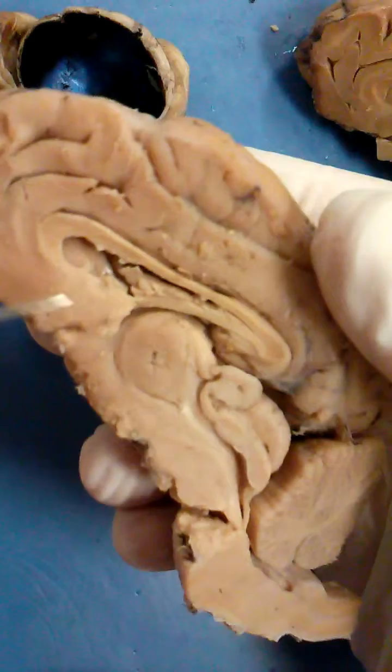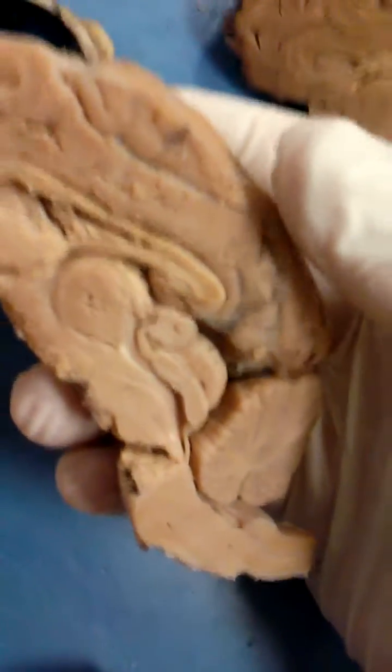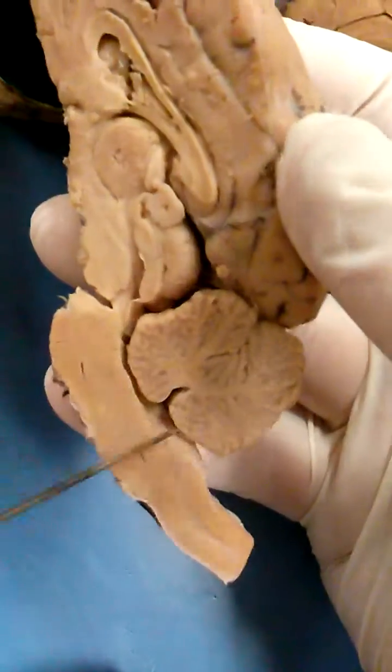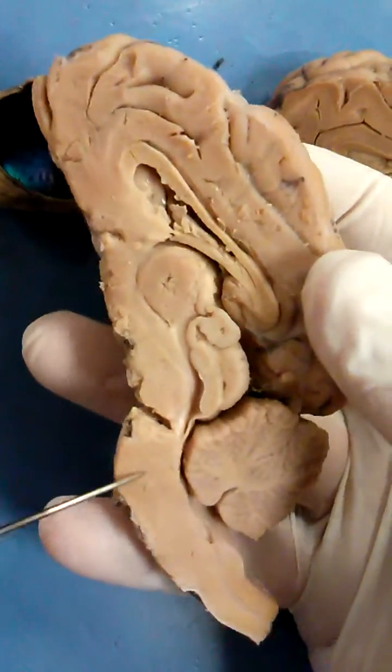And then it goes to the third ventricle — you can't see it here — and then it goes to the fourth. So it goes from lateral to third to fourth.